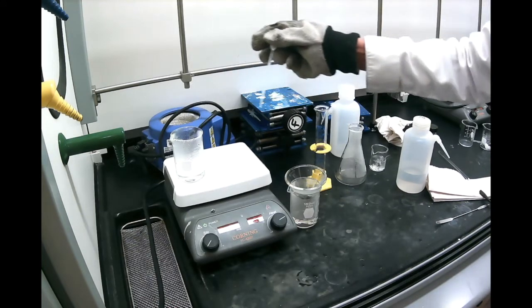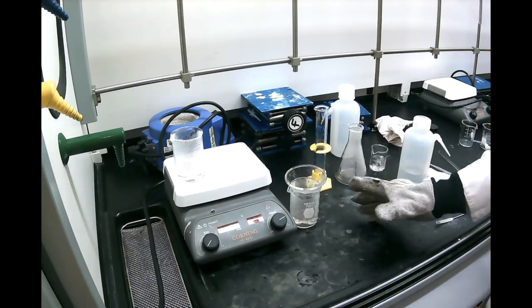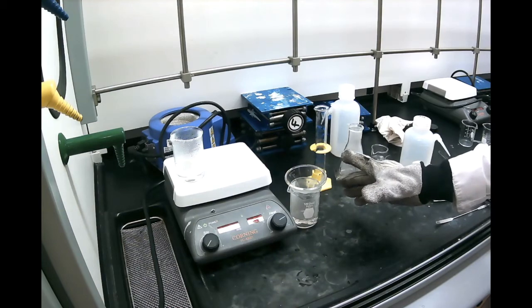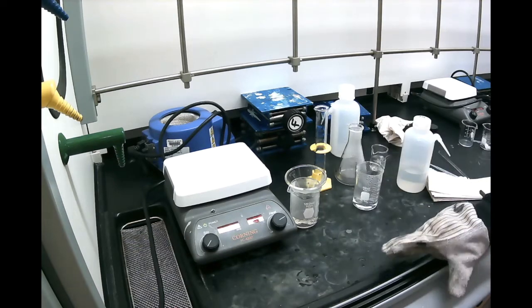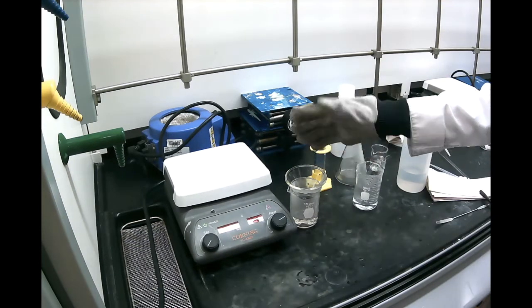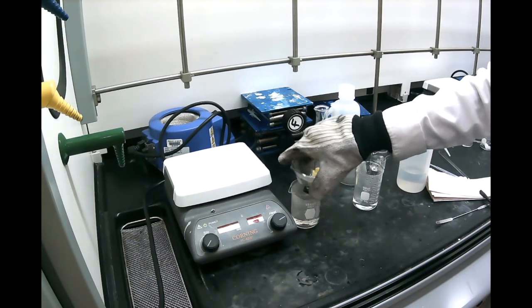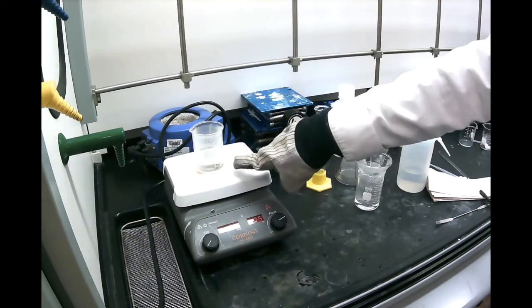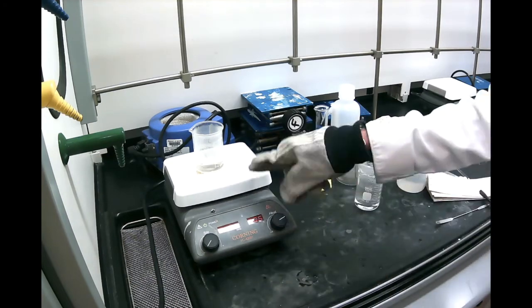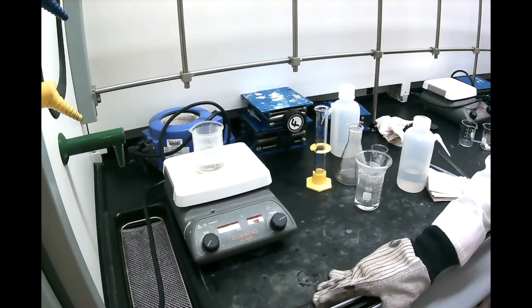So one more rinse, and we're good to go. I'm letting this filtrate completely. I'm done with the hot water. I no longer need it. And now that I finished my filtration, if you remember, we started with 20 milliliters, maybe 30 milliliters, but now we're almost at 40. So what we need to do is heat it to get back to 20 milliliters. About half of it has to evaporate.